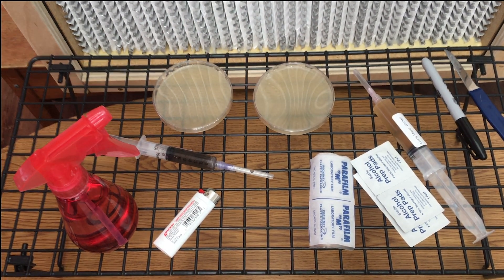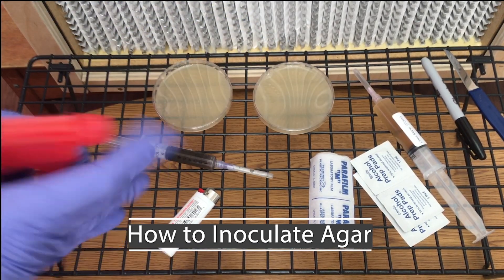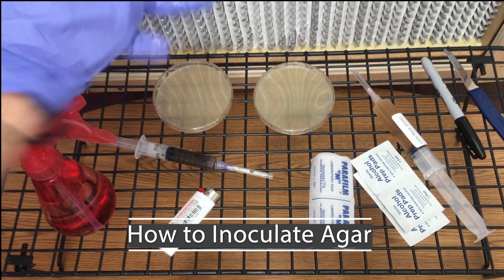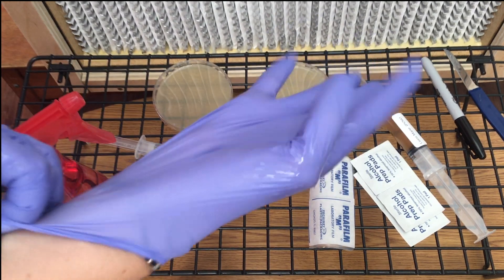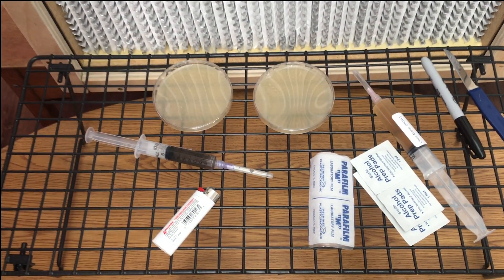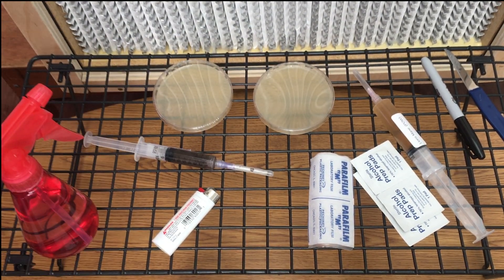Hi, Ashley here, and today I'm going to show you how to inoculate agar with a spore syringe. First I recommend being in front of a laminar flow hood or in a sterile environment, then sterilize everything before you start.